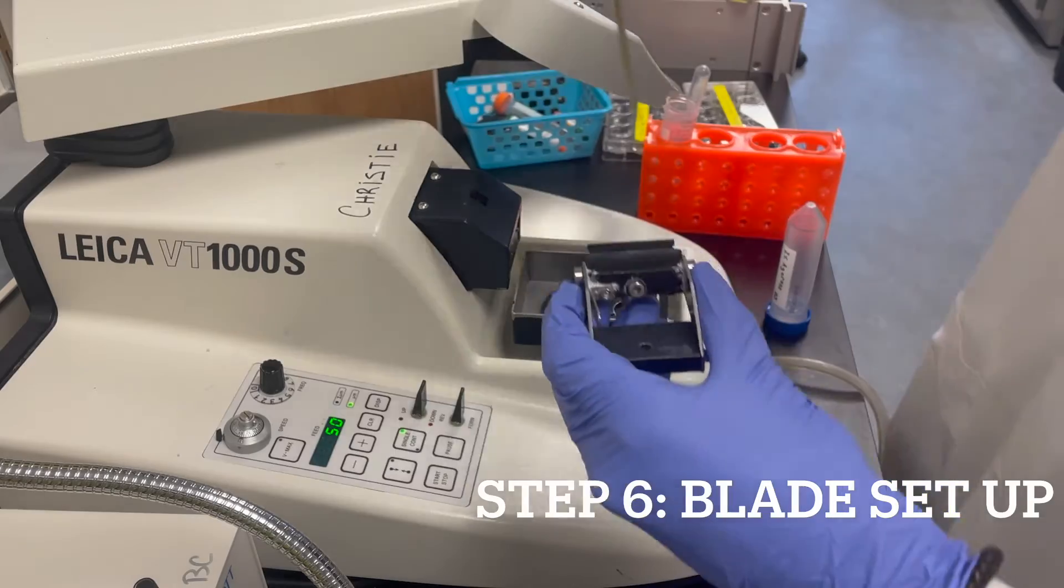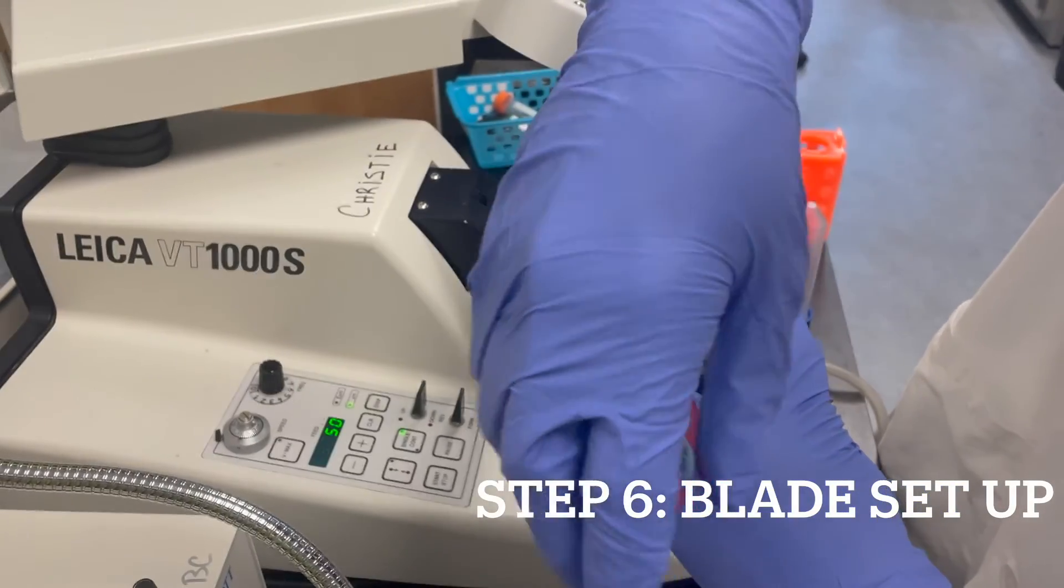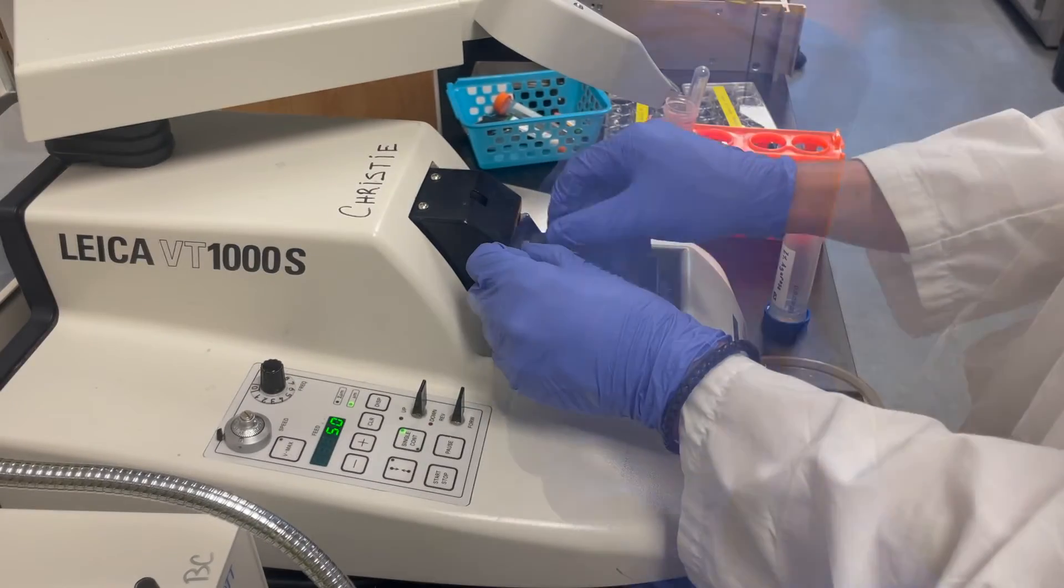Attach a feather blade to the blade holder and use an Allen key to tighten it into place before attaching the holder to the machine.